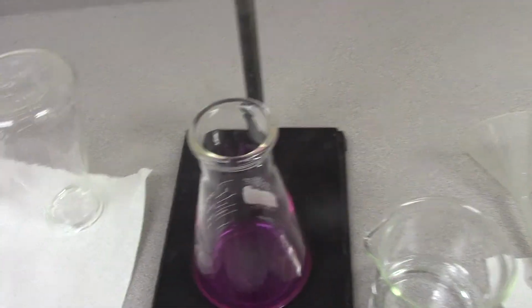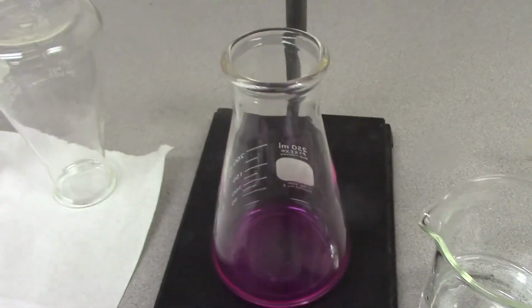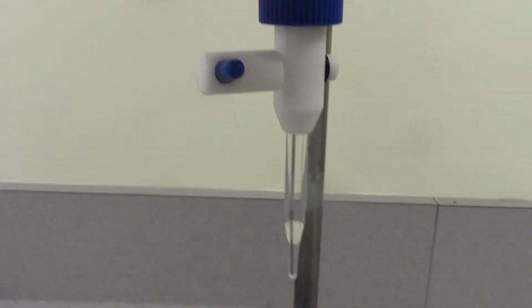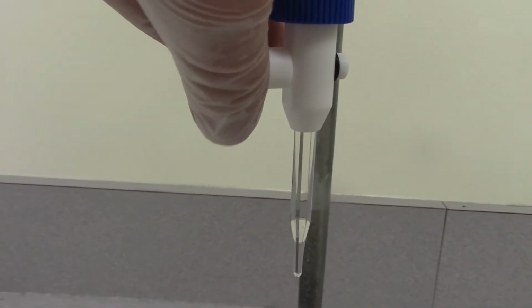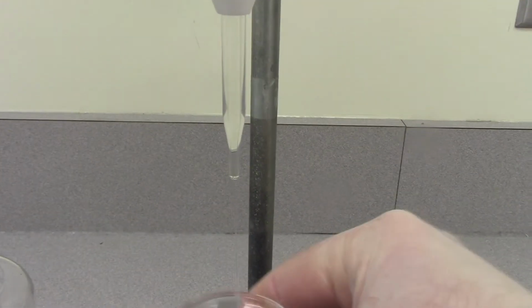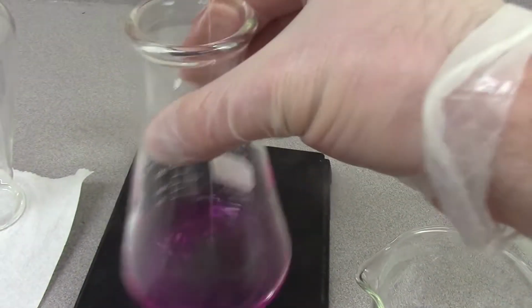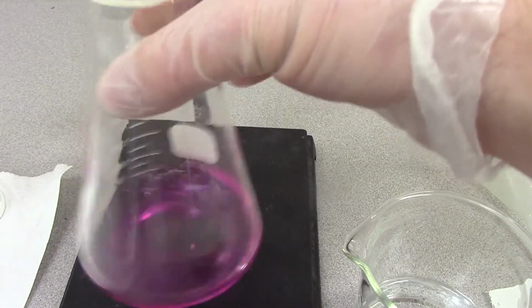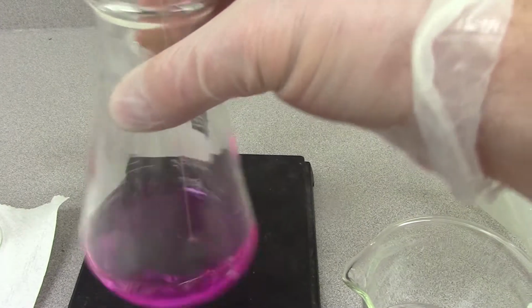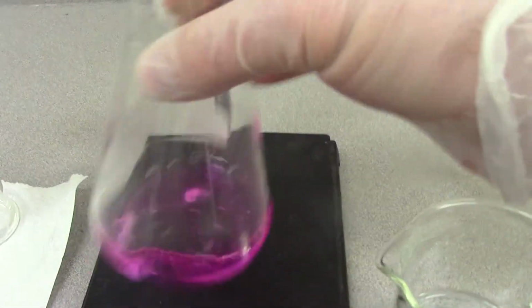And then here's what happens with a titration. Now, this is going to be tough to do with one hand. Okay, so I'm going to take my hand off the stopcock here, and then I'm going to dump the KHP into the phenolphthalein, and we're going to swirl, swirl, swirl.